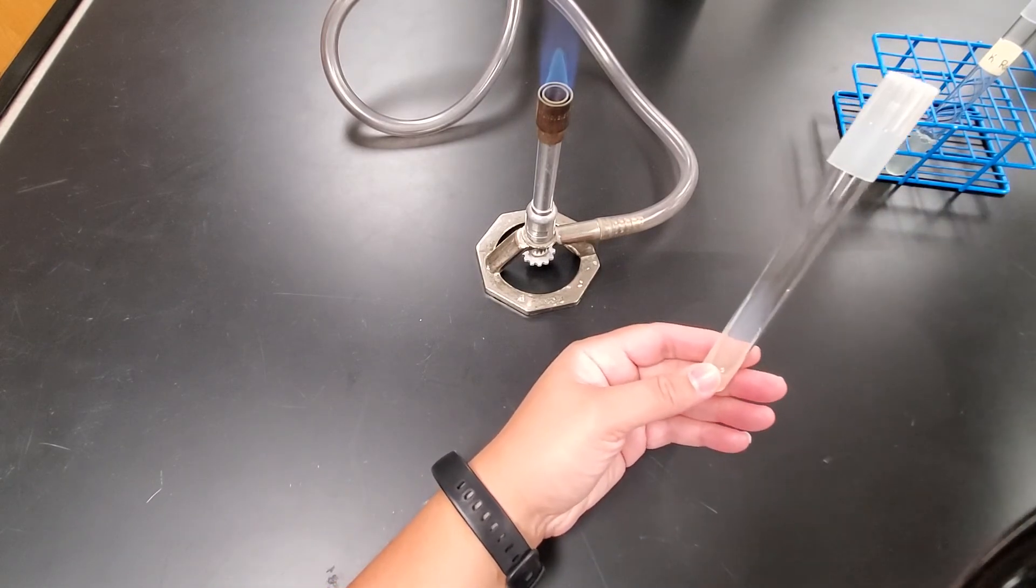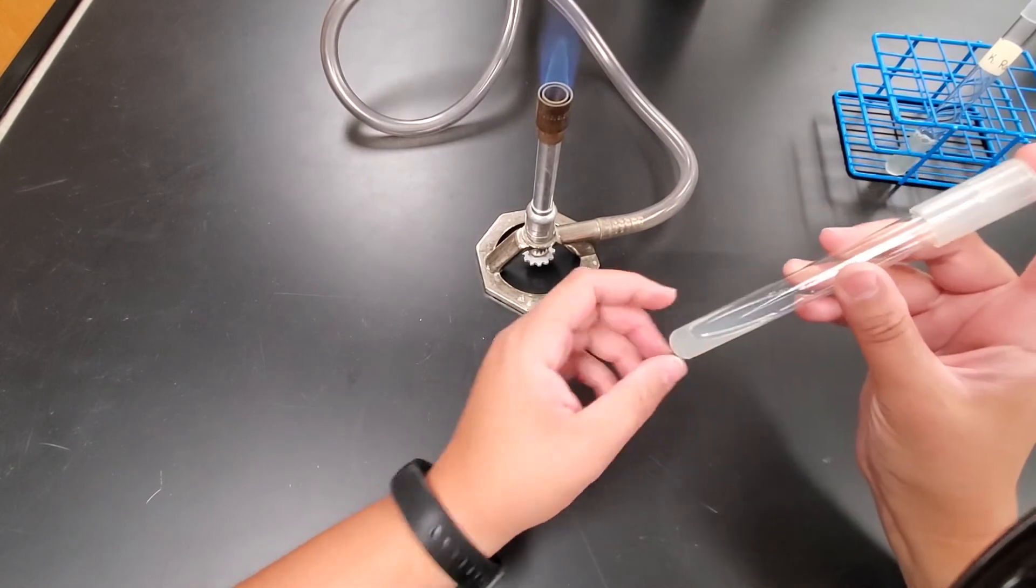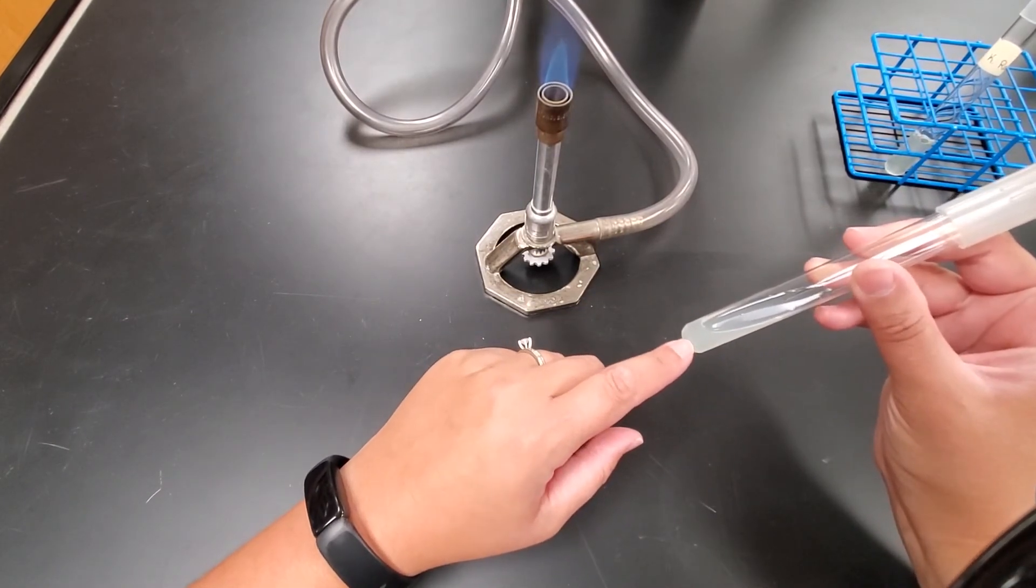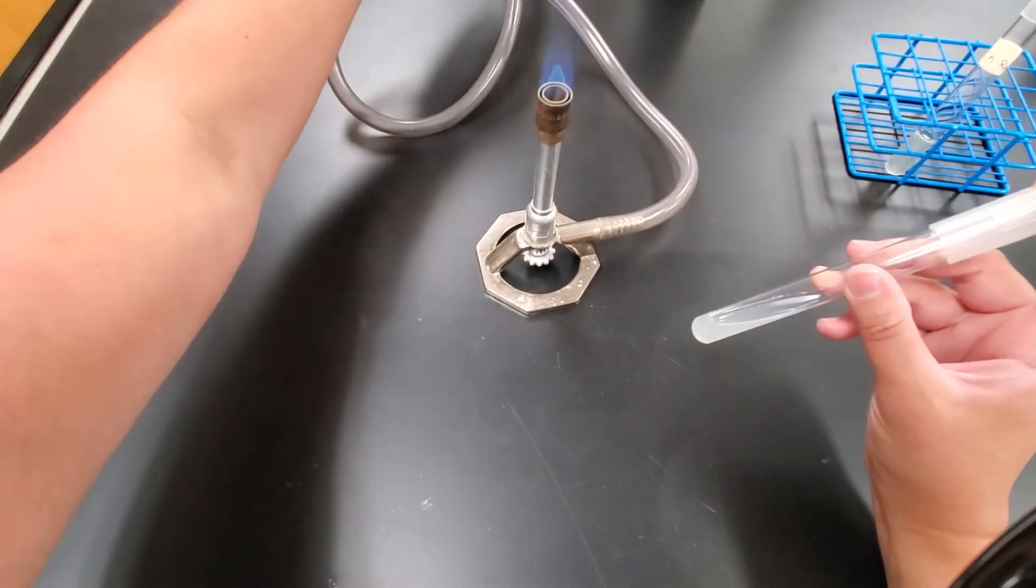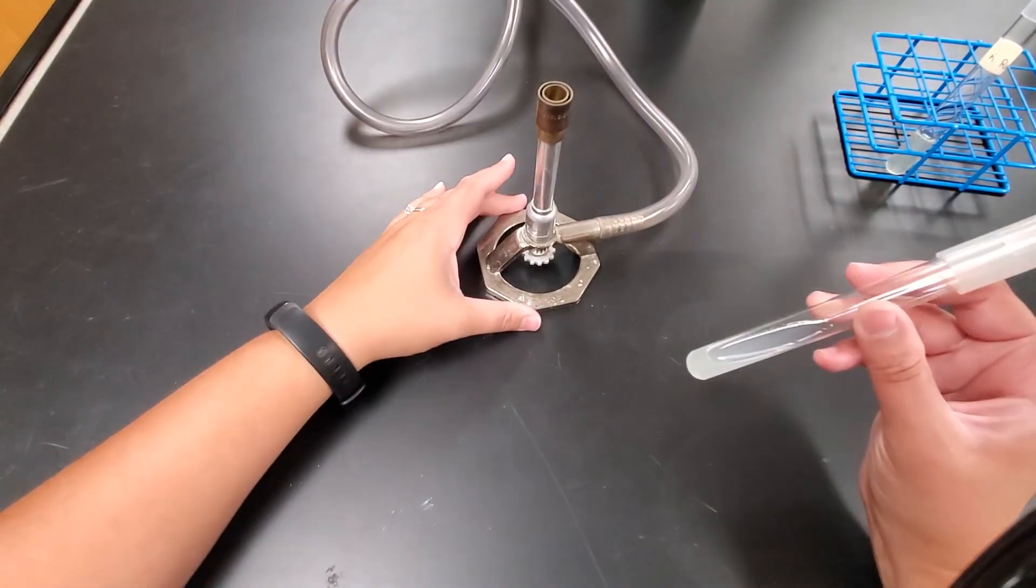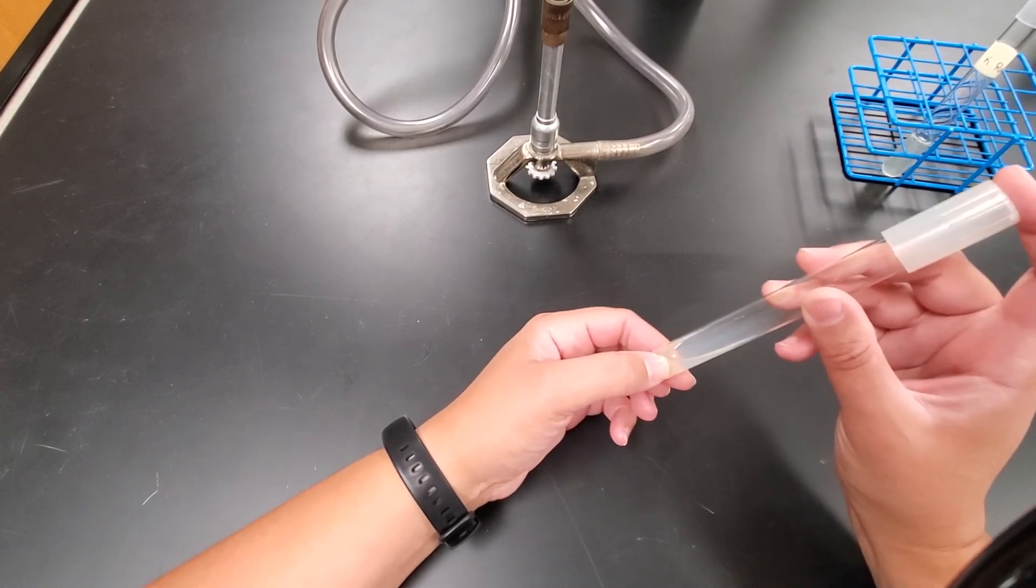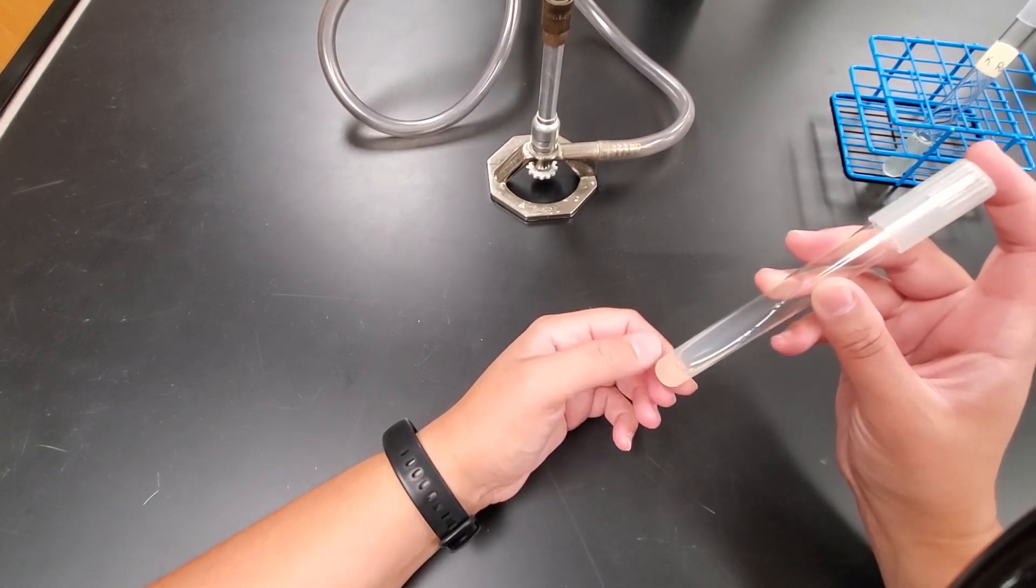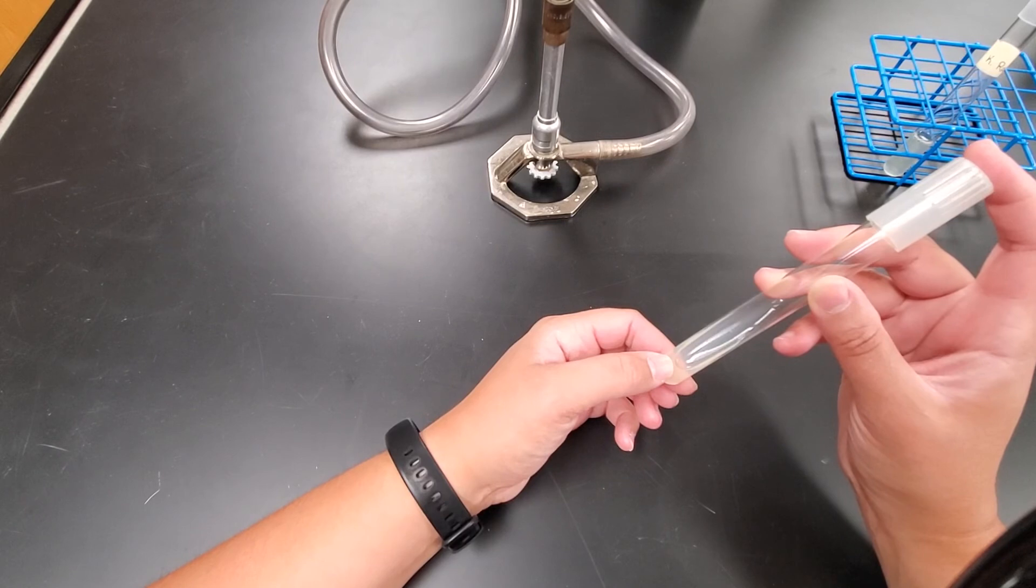you want to be very careful not to press too hard on the agar. I'm doing it very lightly because this stuff kind of has the consistency of jello. And so if it has that consistency, if you press too hard, you can actually rip through that agar, and that's going to destroy your sample. So you want to just do a very light pressure whenever you put that sample on the agar.